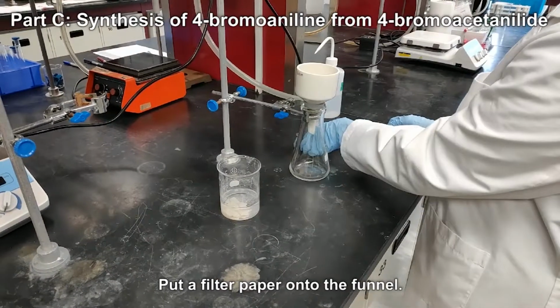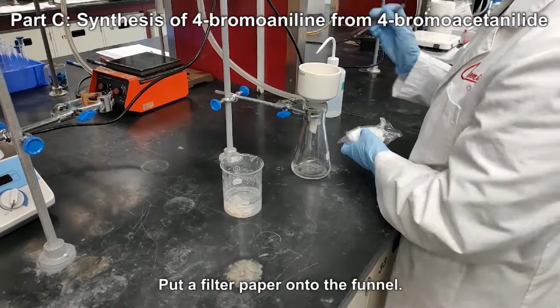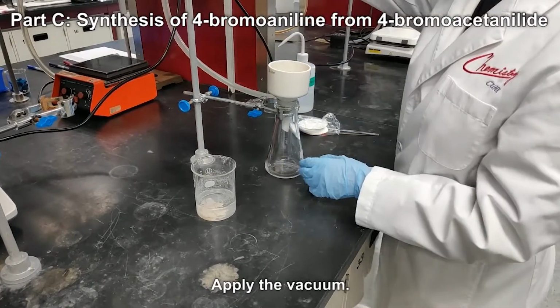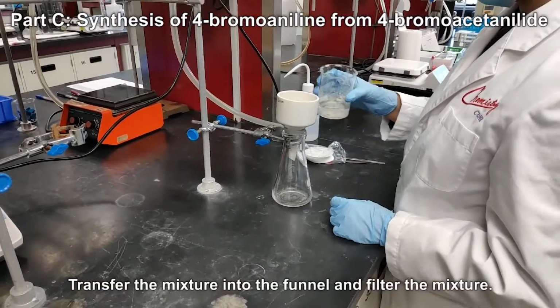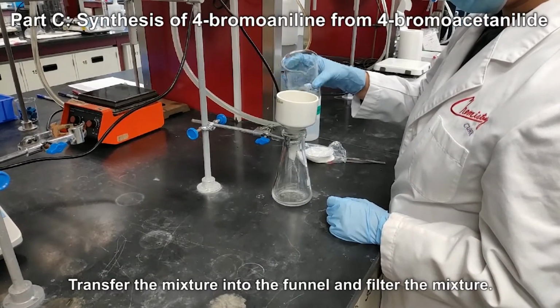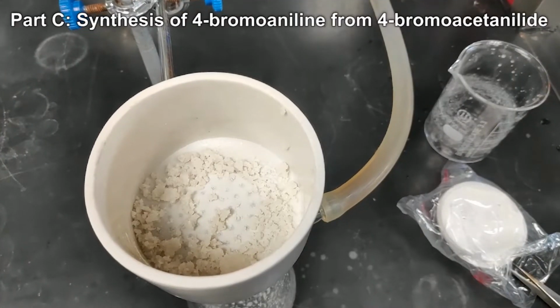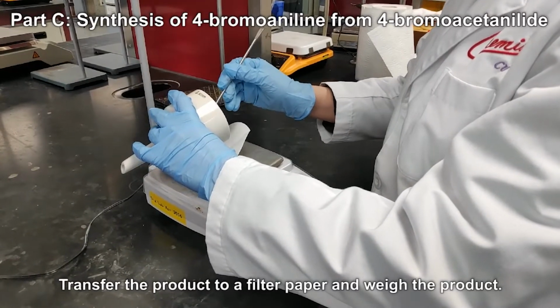Put a filter paper onto the funnel. Wet the filter paper with a small amount of water. Apply the vacuum. Transfer the mixture into the funnel and filter the mixture. Transfer the product to a filter paper and weigh the product.